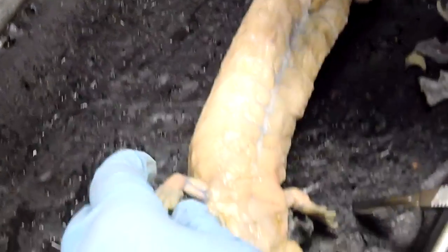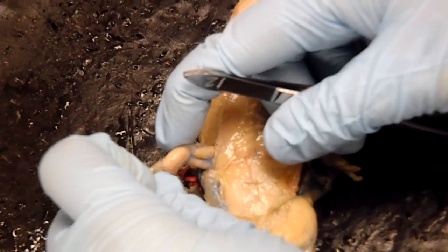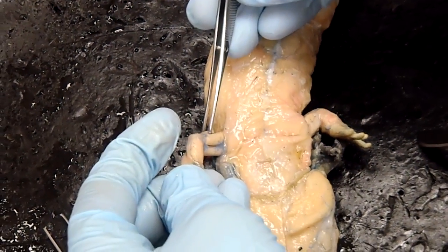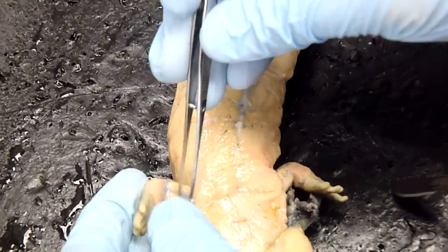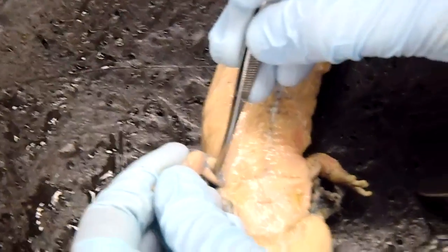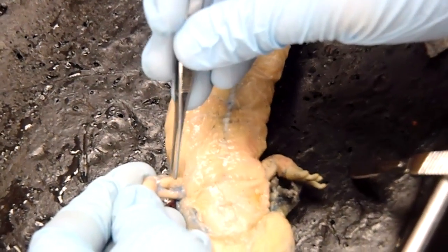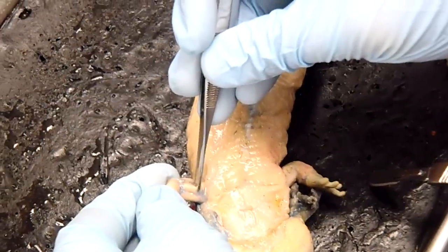Then looking onto his little arms. So here you have your Coracobrachialis in front, Humeroantibrachialis — I think so. Yeah, Coracobrachialis, Humeroantibrachialis.